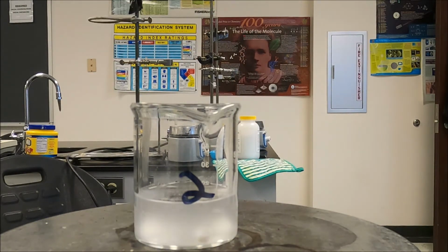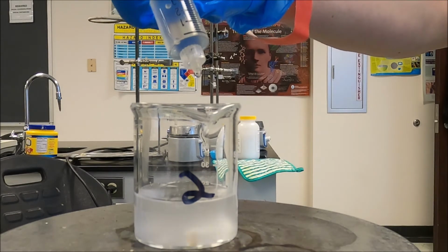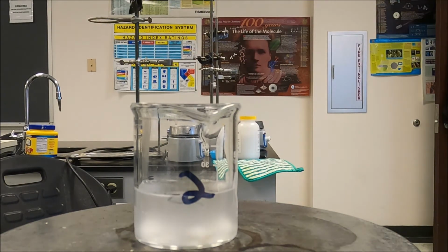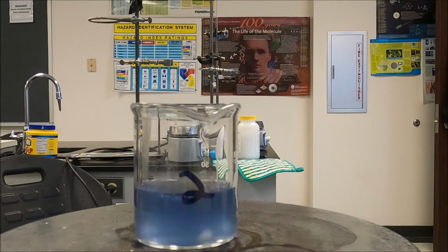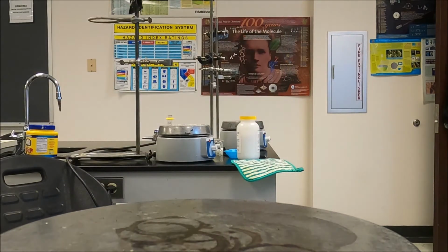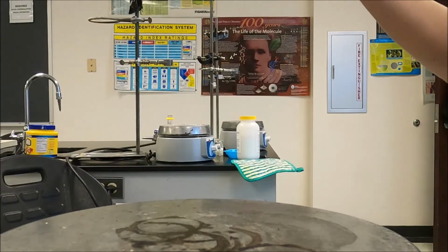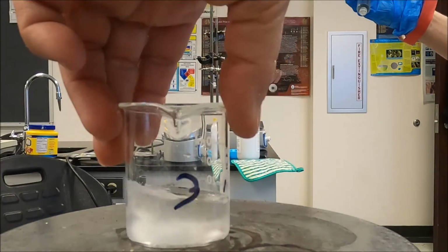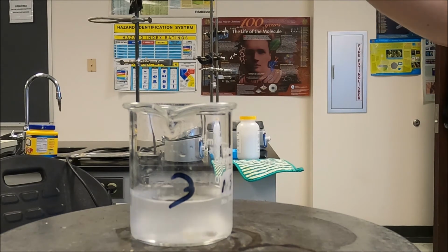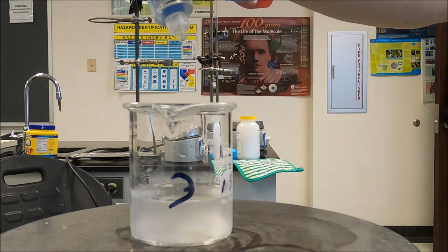Get stirred up there. All right, everybody get ready. Get on your mark, get set, go. All right, let's move on to our next one. Oh, wait a minute, that's 5, not 3. Okay, here's beaker 3. Get it started swirling there. Everything's good mixed up. All right, get on your mark, get set, go.